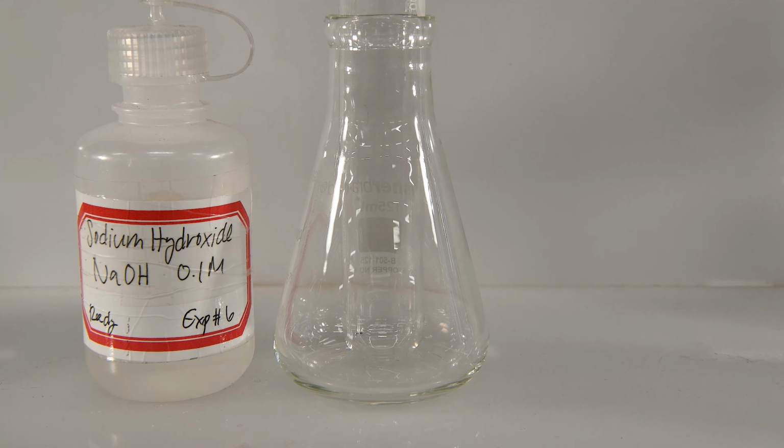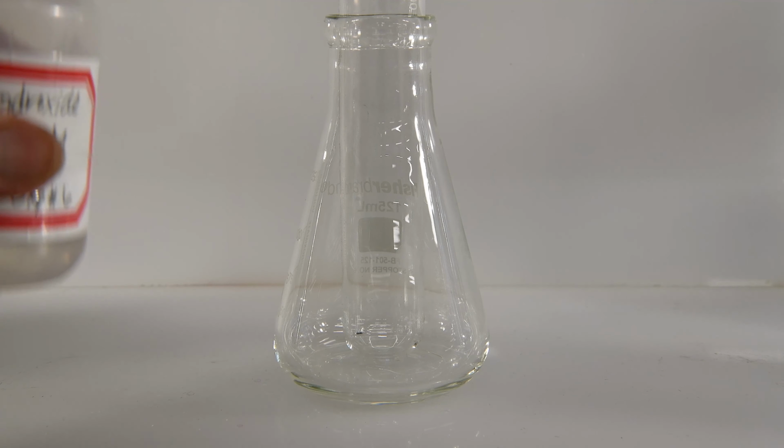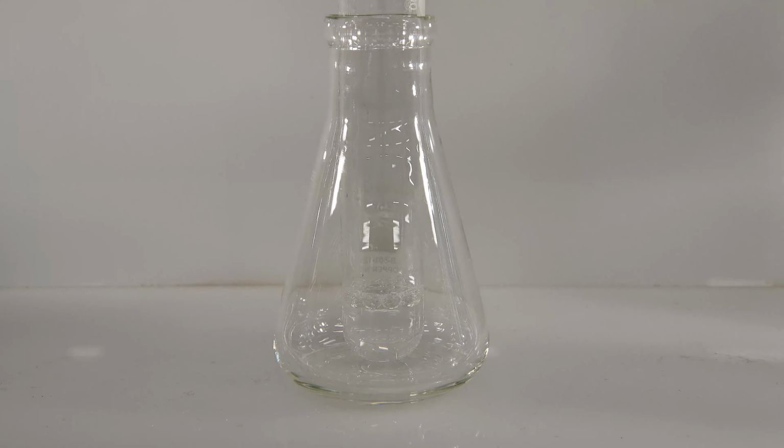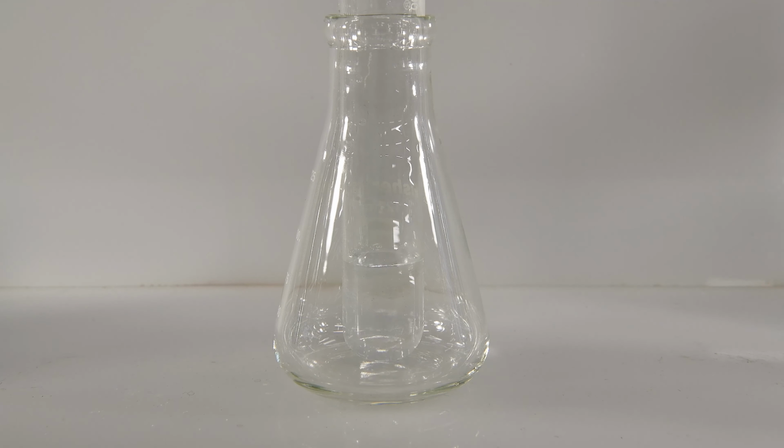Our next series of reactions will be with sodium hydroxide, again with the magnesium, calcium, strontium, and barium, and then our test hydrochloric acid sample. So let's go ahead and add some sodium hydroxide. And we'll add to that some of our magnesium chloride. Okay, doesn't seem to be any sign of a reaction taking place. No bubbles, no precipitate, no color change.